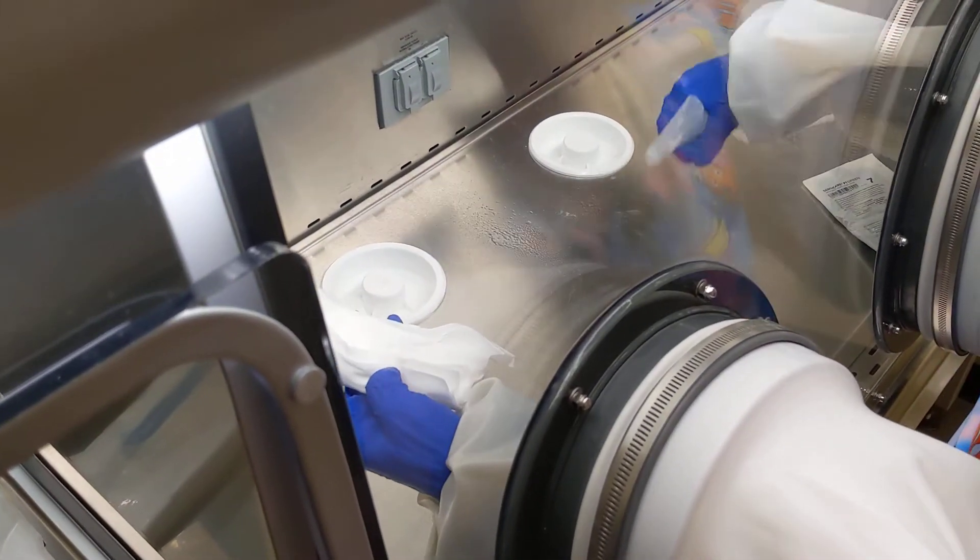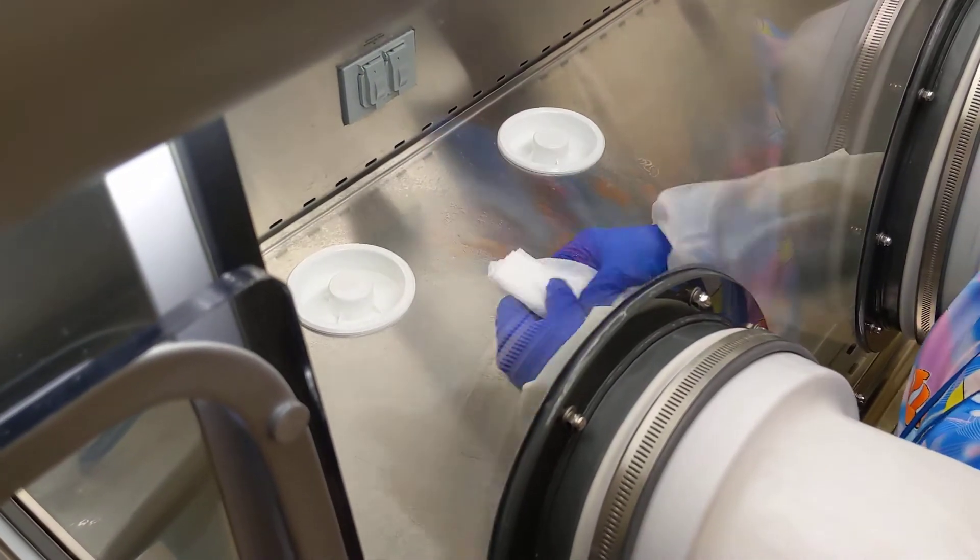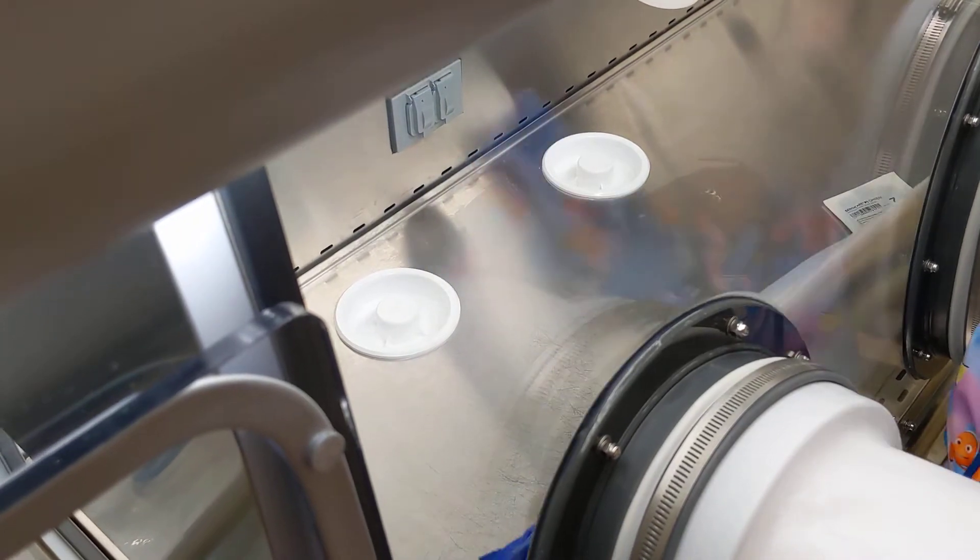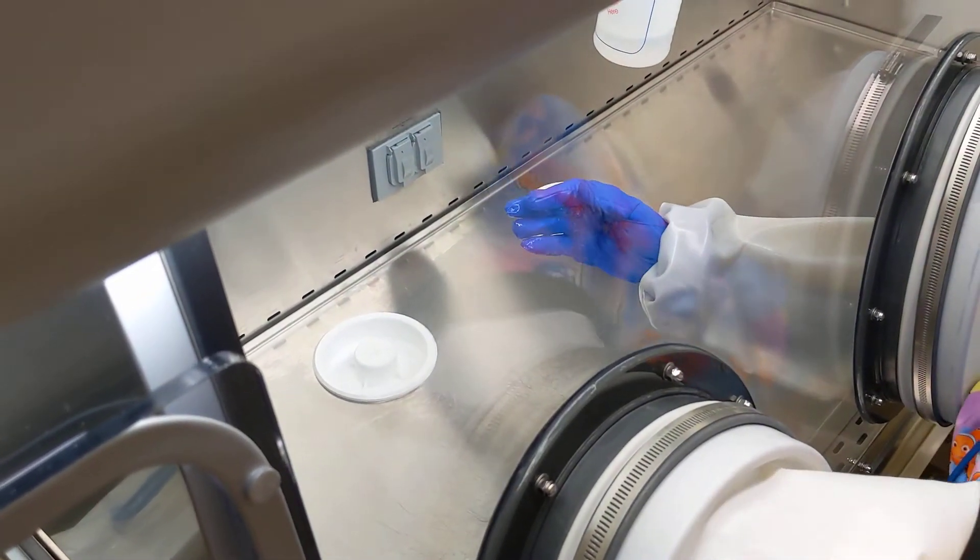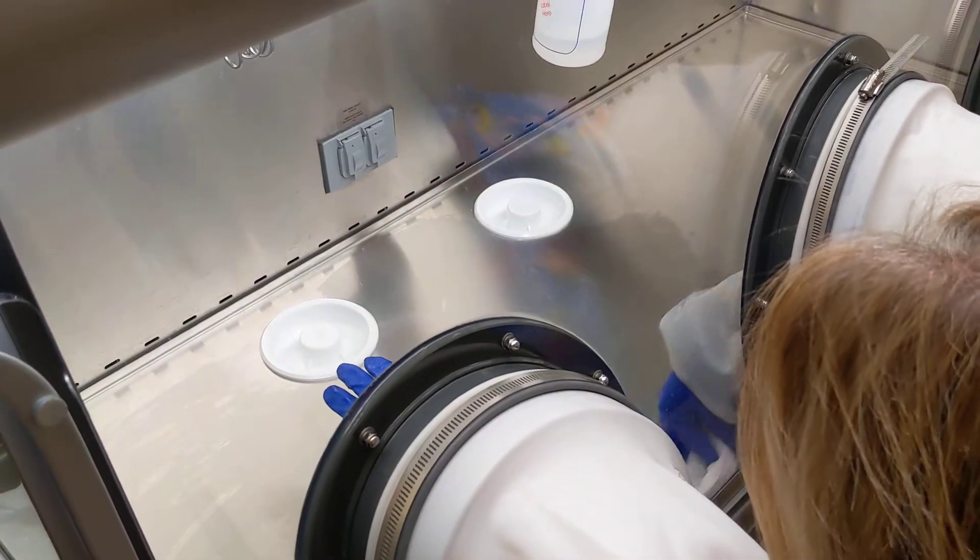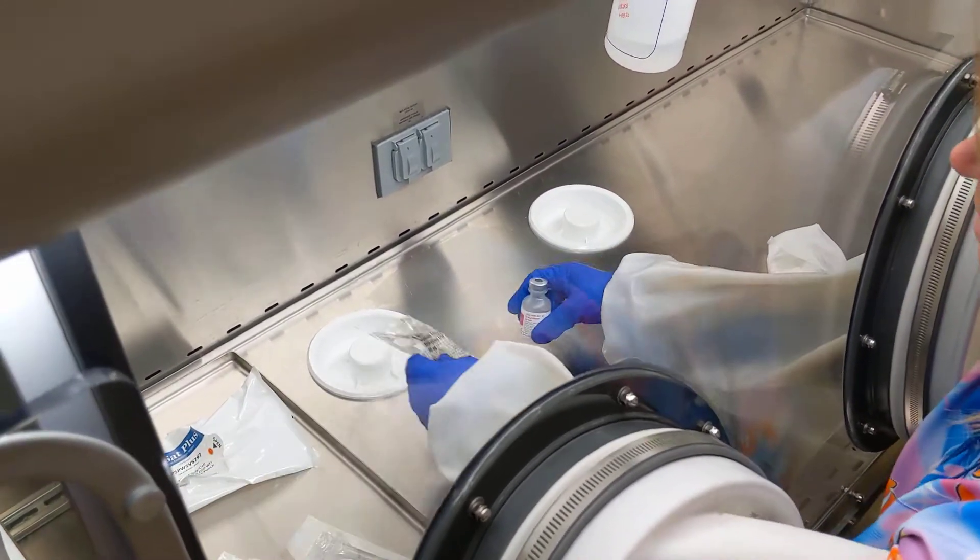Before I mix, even though I haven't been in here for a while, I'll wipe down the surfaces. We clean this hood once a week where it completely gets opened up and wiped down again. Then I can transfer my ingredients in.